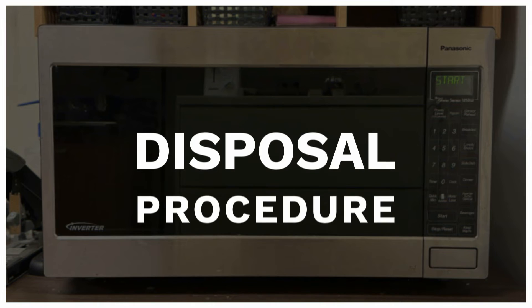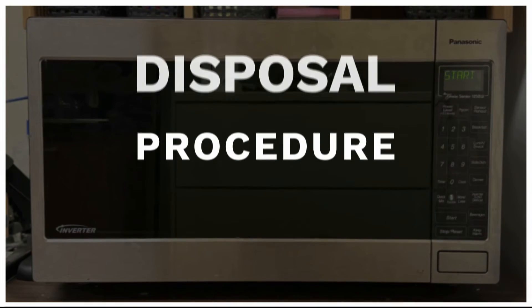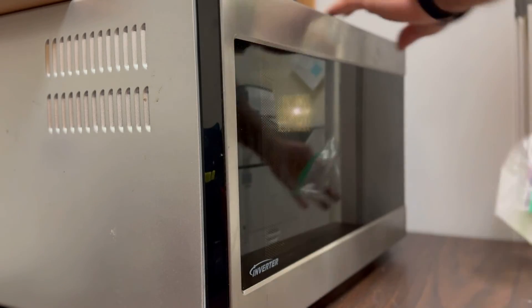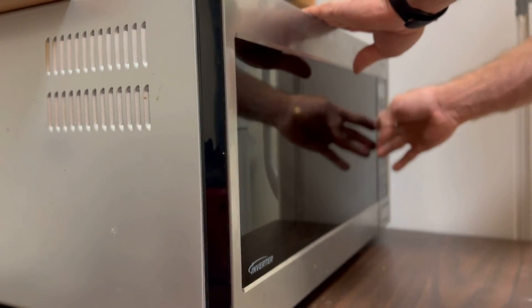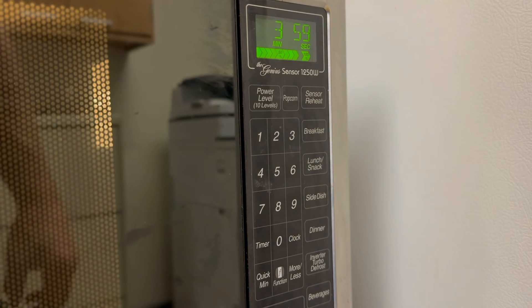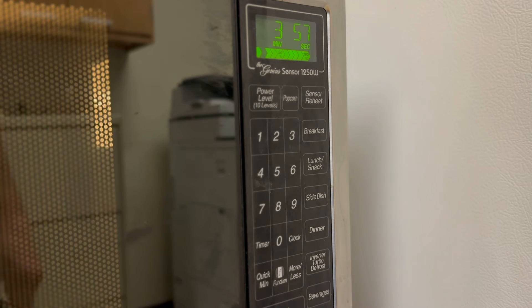After enumerating the cards, you'll want to dispose of them because they are a biological hazard. To do this, simply put the R-cards in a microwave steaming bag and heat them in a microwave for 4 to 5 minutes. This procedure will inactivate or kill any potentially dangerous microbes.